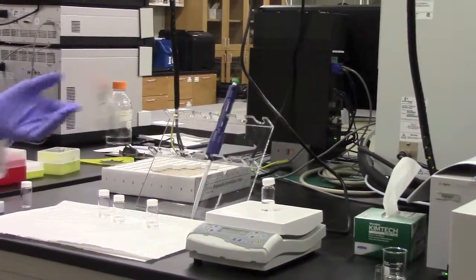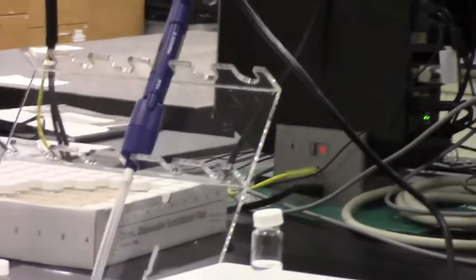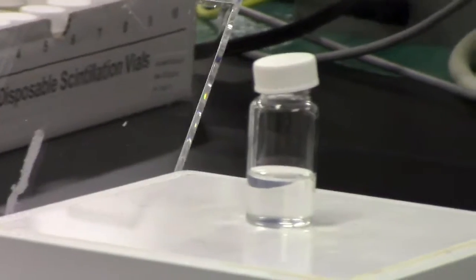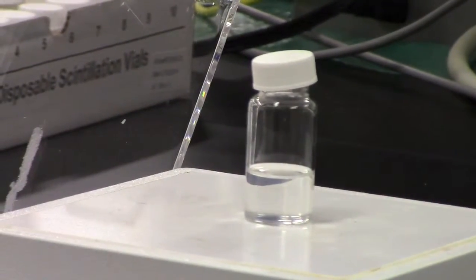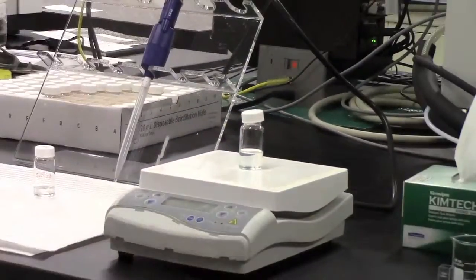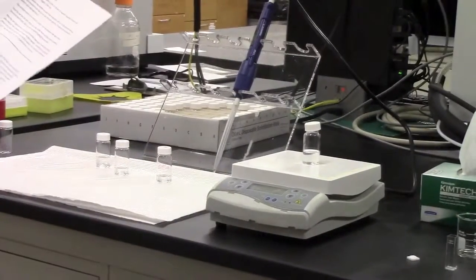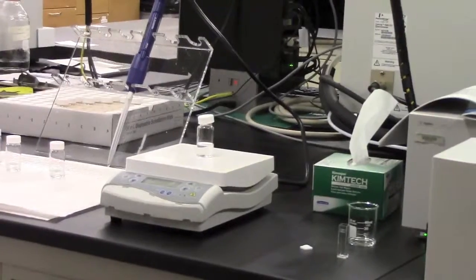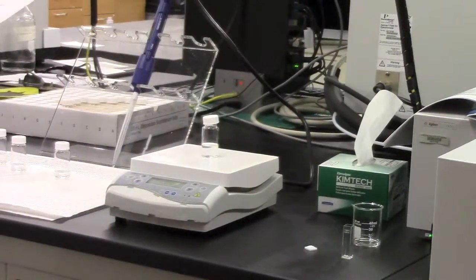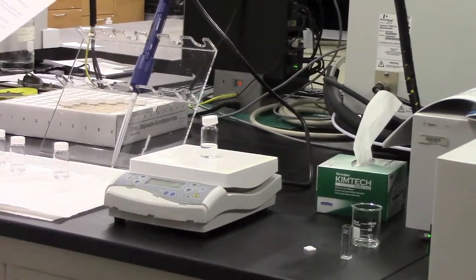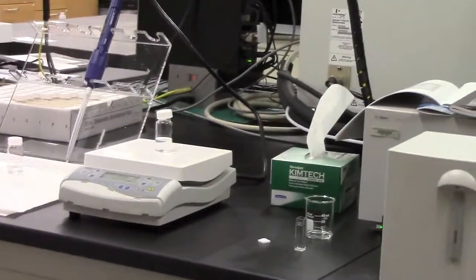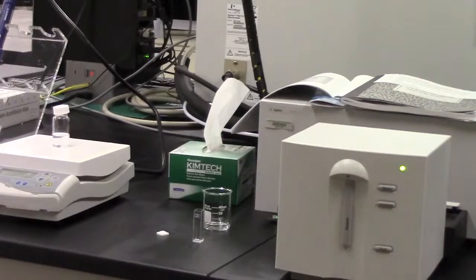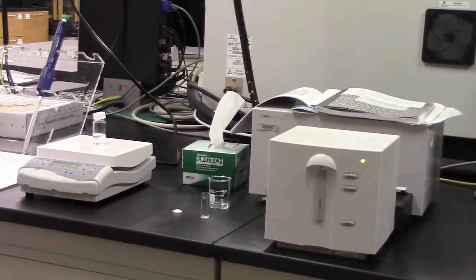After this initial spectrum has been taken as was demonstrated, you'll want to take a spectrum every 10 minutes until 30 minutes have elapsed. At which point, you should take a spectrum every 5 minutes until 45 minutes have been reached. You'll take another spectrum at the 60 minute mark, at which point you can remove the reaction solution from the hot plate, turn the hot plate off, and then take a final spectrum at the end of the lab period prior to cleaning up.